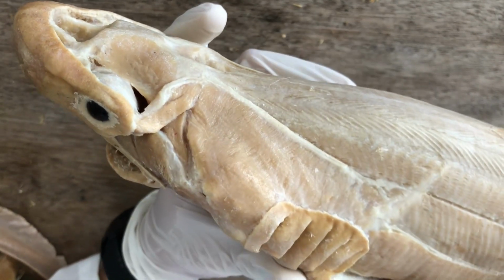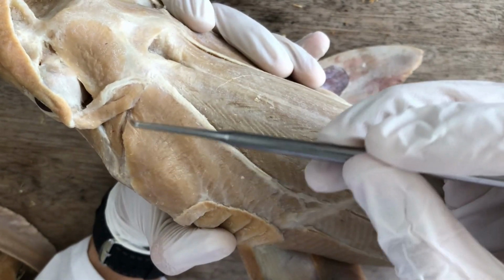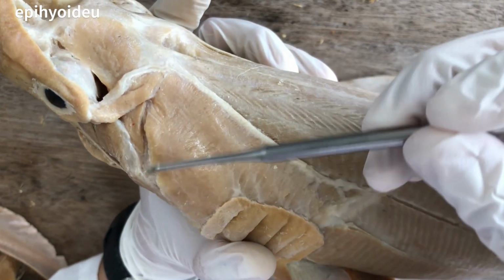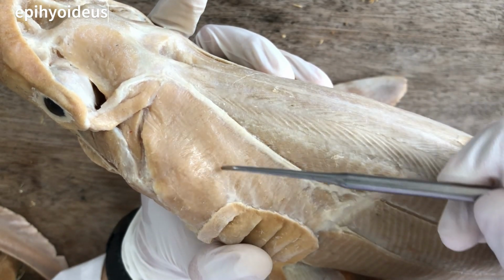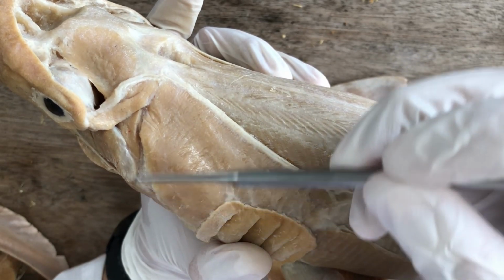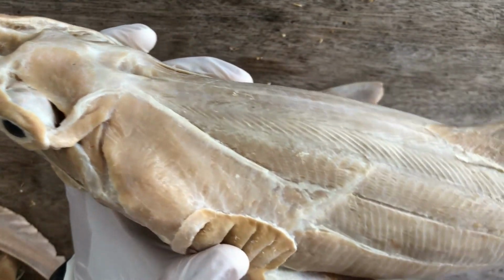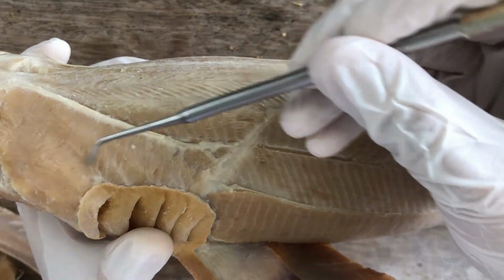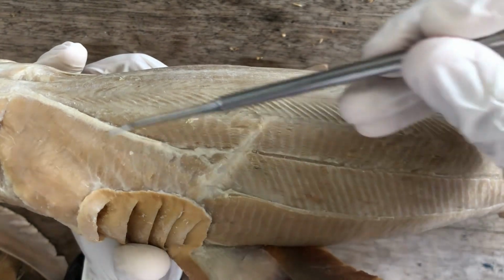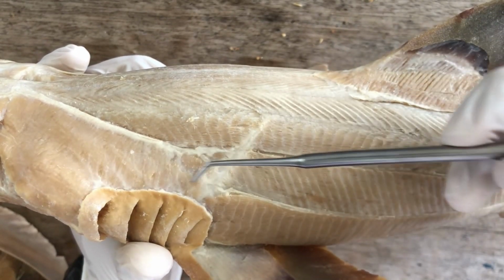The dorsal constrictor of the second arch, the hyoid arch, is this large muscle here, just before the first gill slit. This is the epihyoideus. In some texts, it's called the epihyoidean muscle. So that's the second dorsal constrictor muscle. And then the dorsal constrictors of the remaining arches, they don't have special names, fortunately for you. So these are just referred to as the dorsal branchial constrictors. You can call them that.